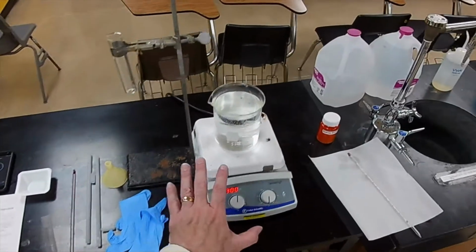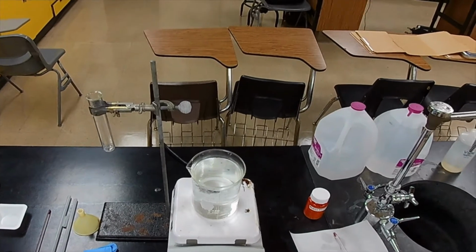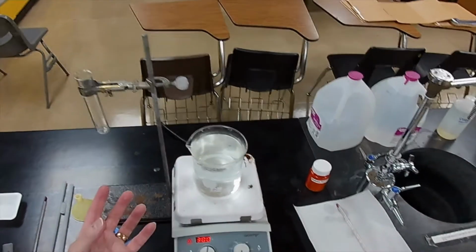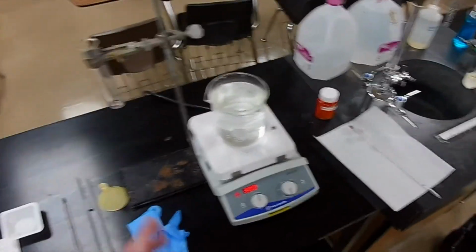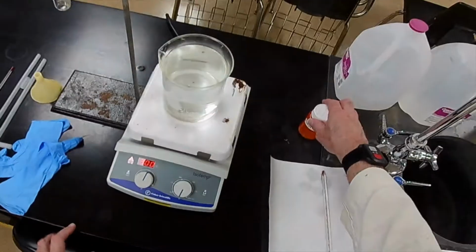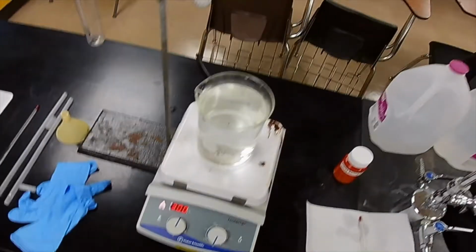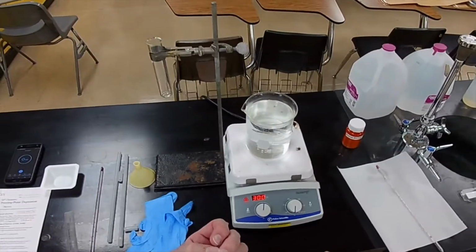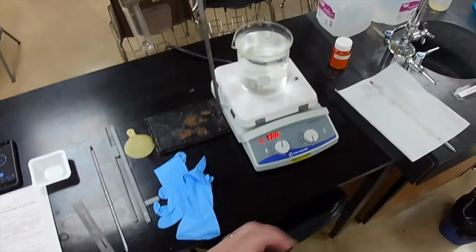In order to keep the water from bumping, if you know what bumping is: if you heat something on a hot plate, when you near the boiling point, the liquid has a tendency to all of a sudden burp out some of its vapor. That's characteristic of just about every liquid. So in order to avoid that, we use boiling chips. These are just pieces of pumice, and you may or may not be able to see them down in the bottom of that beaker. What that does is it creates a nucleation site for the vaporizing liquid to gather in smaller amounts, so we don't get the big burp. We get little small bubbles.